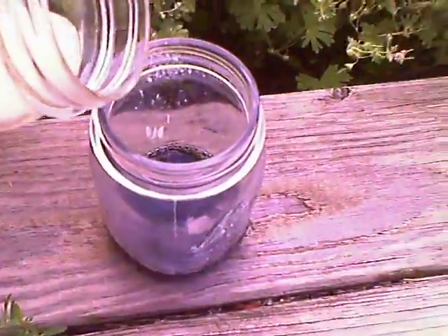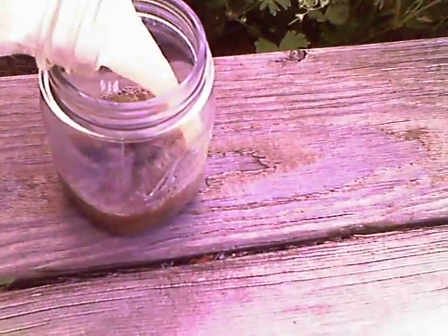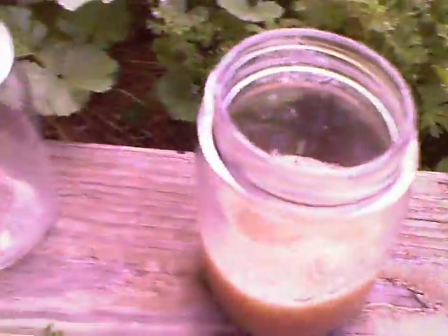Okay, so let me pour it in. It's going to change color very rapidly to this orange-ish color. There was a dark green before. This isn't just the colors mixing together, because when you're done and this is falling out, it'll end up looking like this, and there'll be a precipitate. When it's not moved for a long time, you'll have these crystal-like properties.